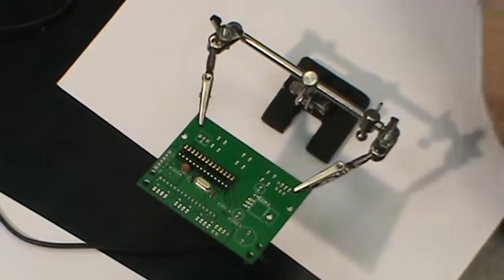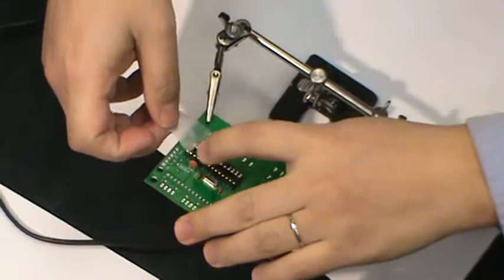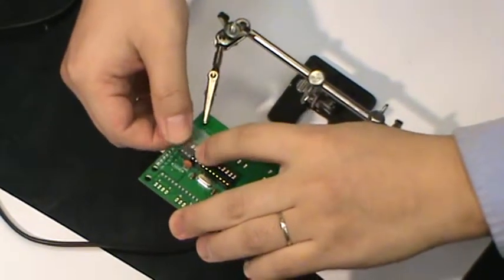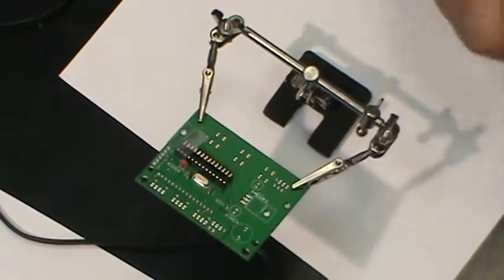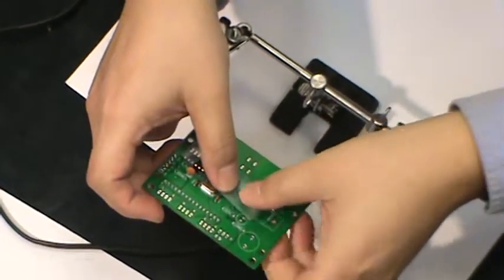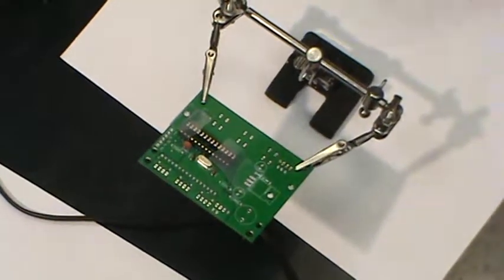Okay, so now we have tape. I'll just take a couple pieces and just secure the part. You don't really have to secure it so much because once you solder 2 pins on this part, the part is already secured, then you can remove the tape. Okay, so now this is actually taped on pretty well.